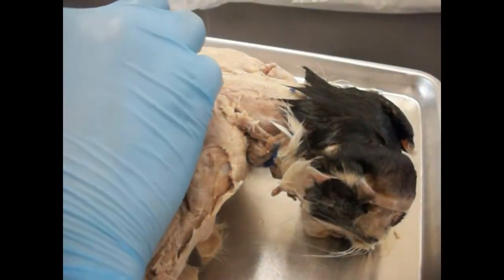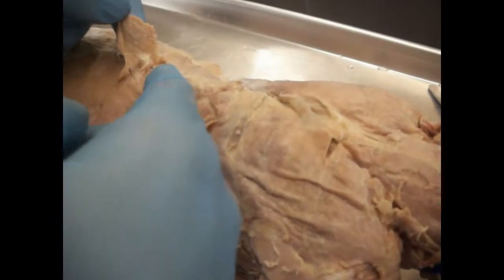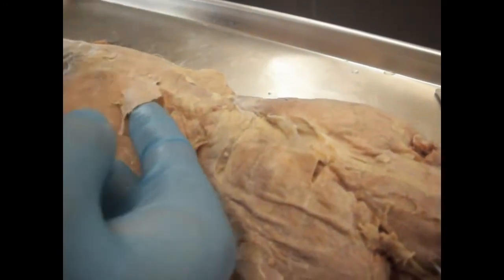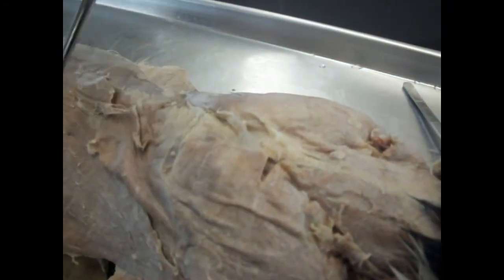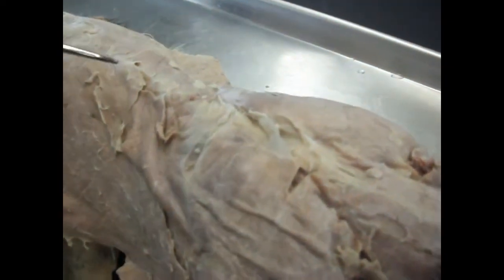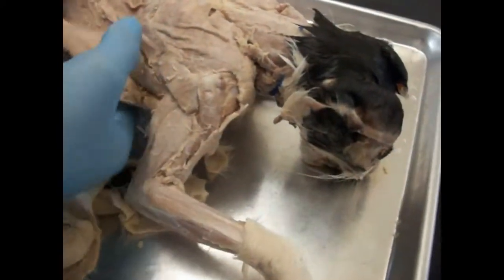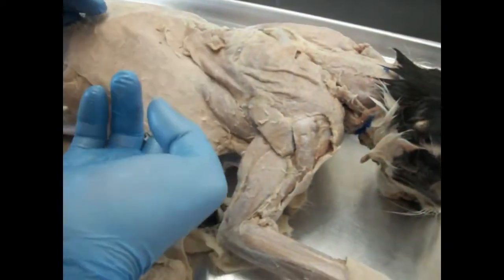So moving on. The muscle that I'm holding with my left hand is called the spinotrapezius, and it's called that because it's closest to the spine. An interesting fact about the spinotrapezius is that it connects directly with the acromiotrapezius, as you can see there. And last but not least, our favorite muscle, the latissimus dorsi.